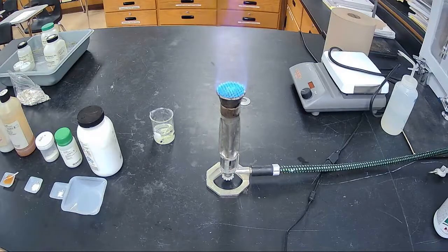So today, guys, we're going to be doing a series of flame tests. We're going to test 9 different metals, compounds that have metals in them, to see what colors they produce. So your job is to look at the flame test, match up the color with the element that is producing that flame. Remember that when we hit these metals with energy, the flame is supplying the energy. You're going to see a characteristic color for each individual metal.